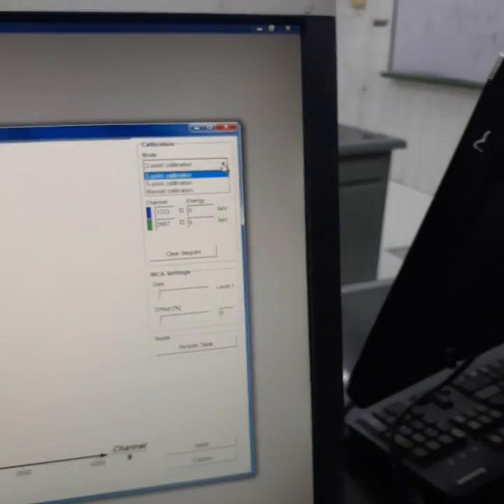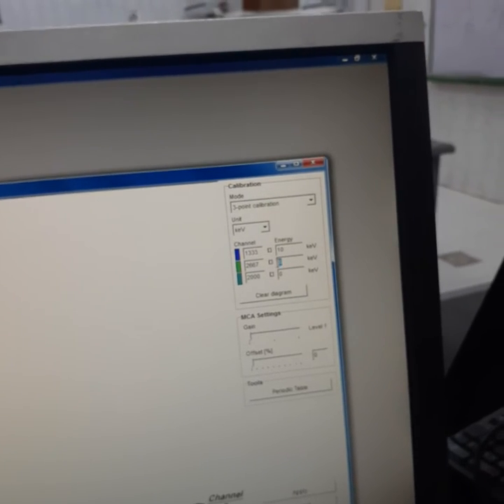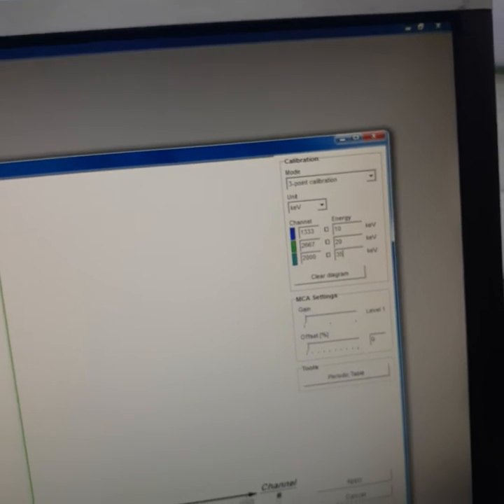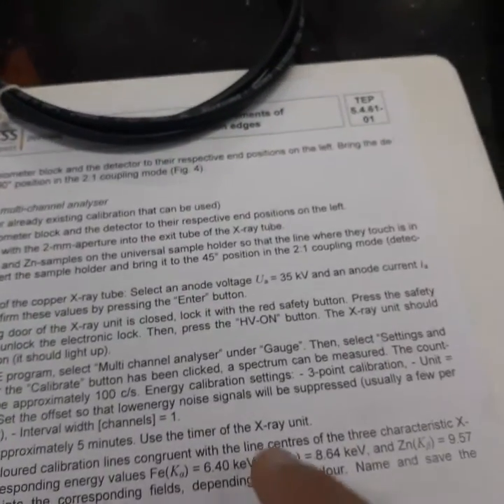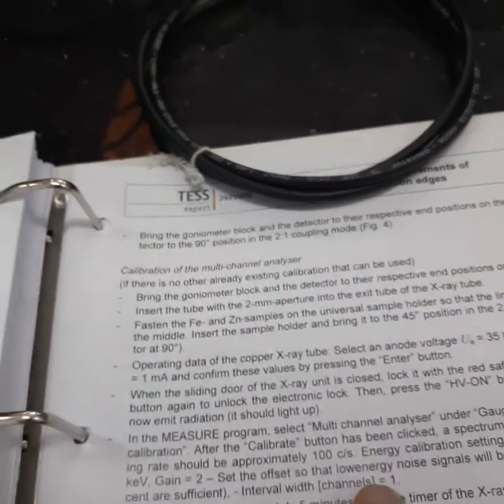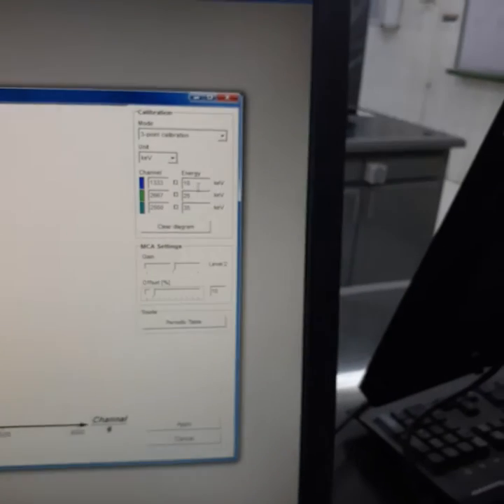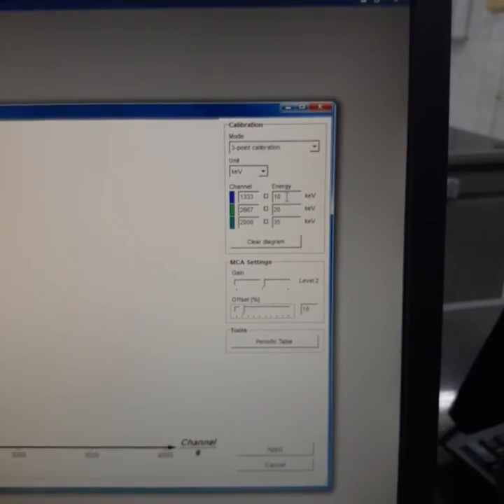We will choose the 3-point calibration mode, and we will set this value to 10 as an example, and this value is 20, and this value to 35. Then we will set this value to level 2, and the offset value should be 10. I think all these parameters we have chosen according to the manual here. The gain should be 2, and also here the 3-point calibration mode and interval width. I think there is no interval width here. The interval width channels should be equal to 1. I think there is no interval width here, but you may send us your comments about this point, because there is no interval width in the software.